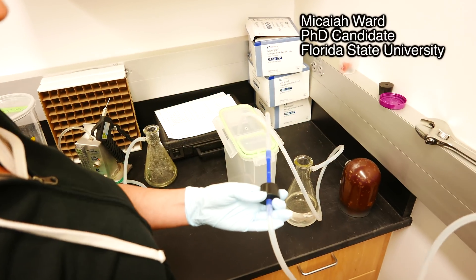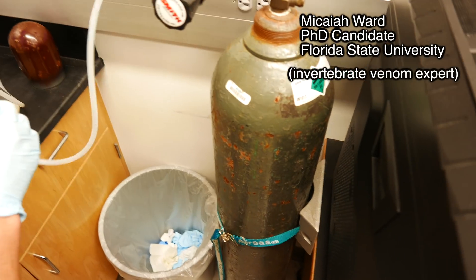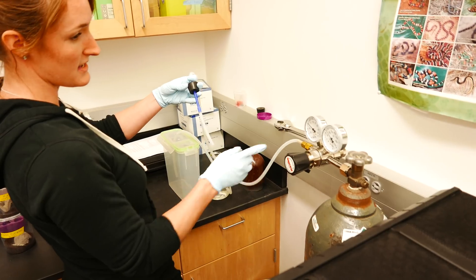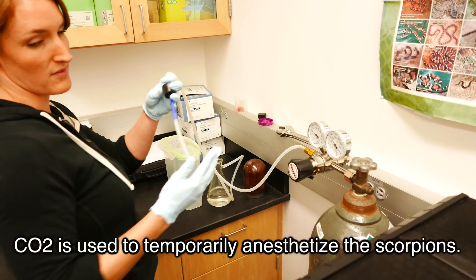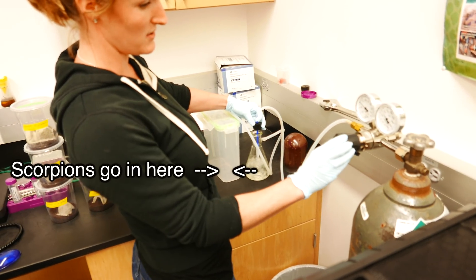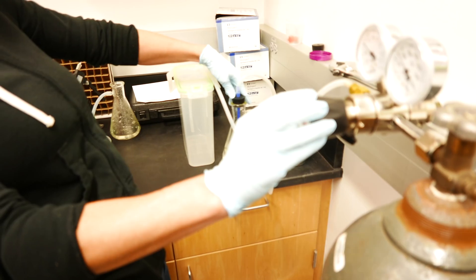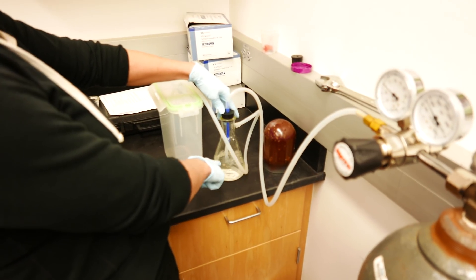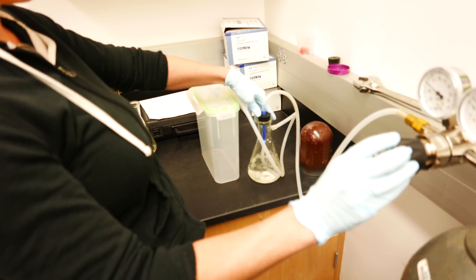So this is the CO2 and it's got one output. When I turn this on, you can see that even when it's really, really low, you can feel it quite a bit. You don't need it that high — you get all those bubbles; that's way too high. I'll decrease this and then decrease even more. Rather than looking at the gauge, I'm more looking at this — just gauging the bubbles.